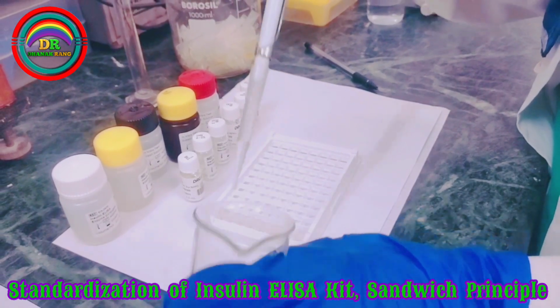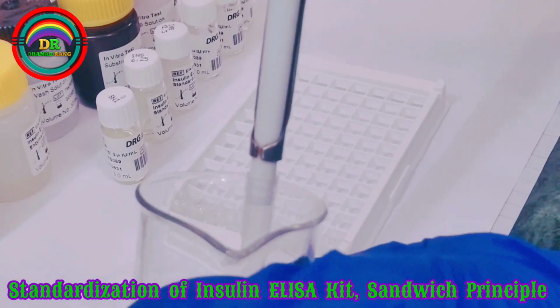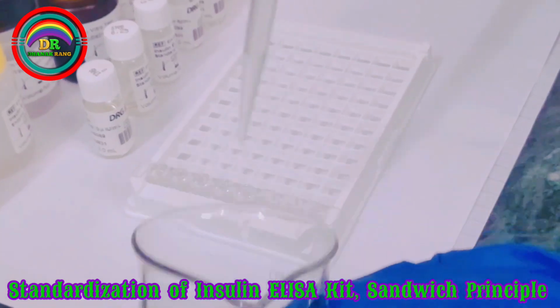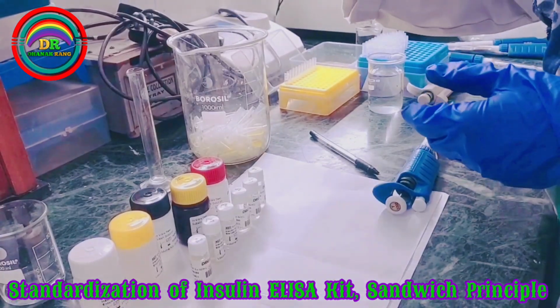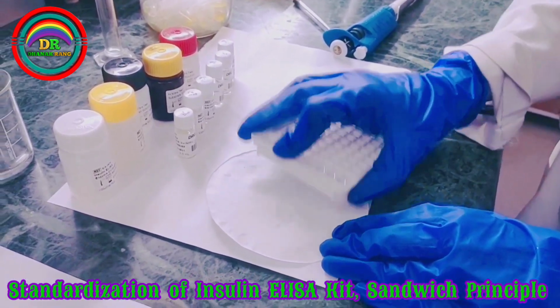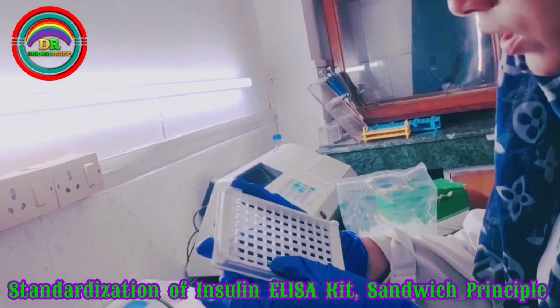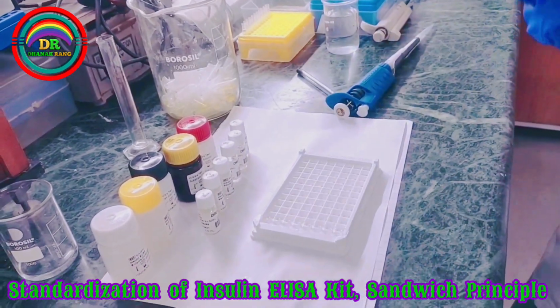And the final third wash. We'll tap the plate on absorbing paper or filter paper to remove any droplets. We'll make sure that there are no droplets of wash solution left in the microtiter well. Then we'll proceed with the next step.